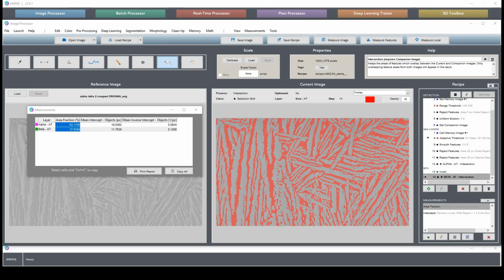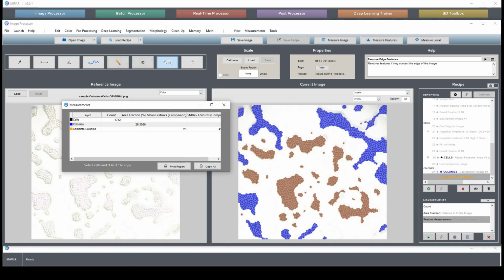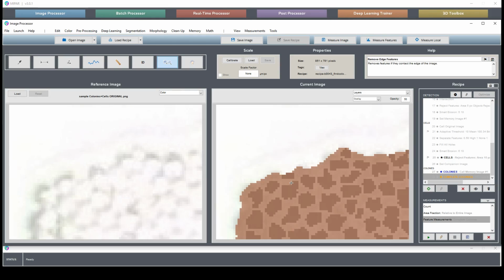So let's switch now to our colonies. We have a recipe, and we'll load back in this recipe that we used. In this image, the specific errors I'm looking to remove are pieces that are concave on the edge of a colony. So these are being found as cells here.